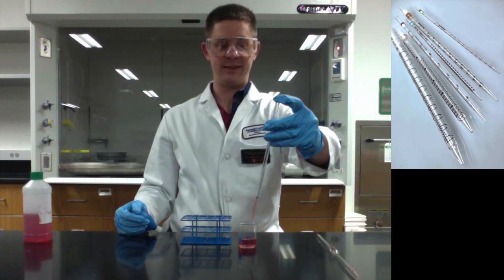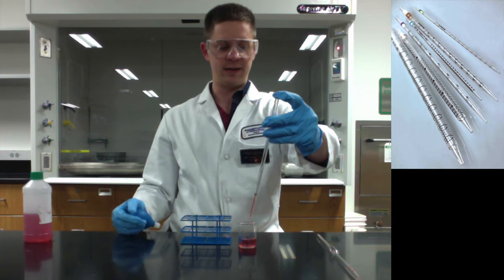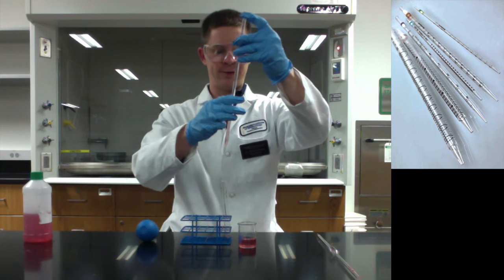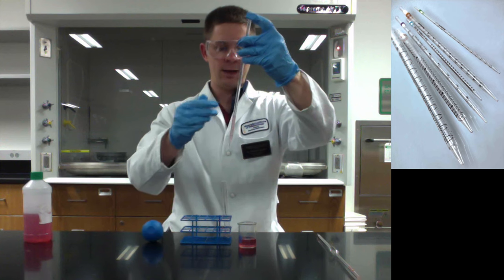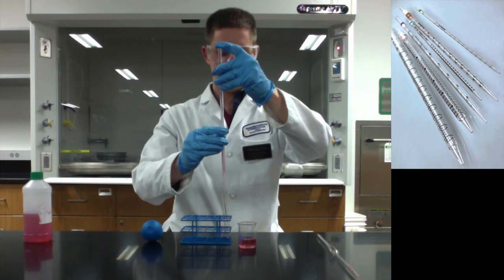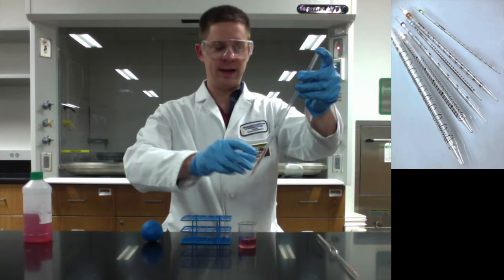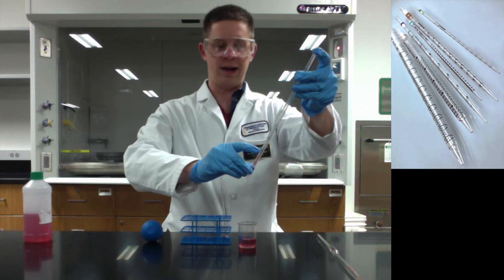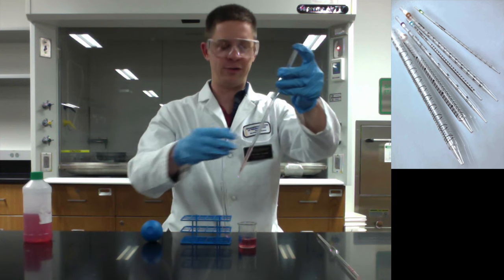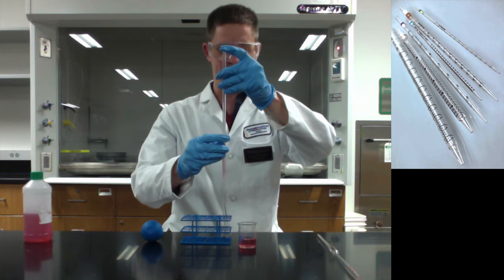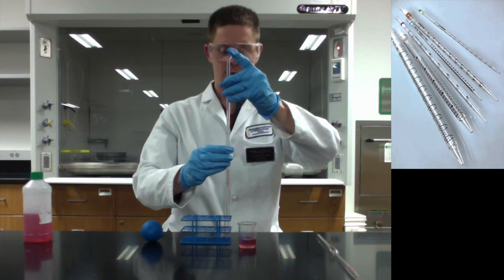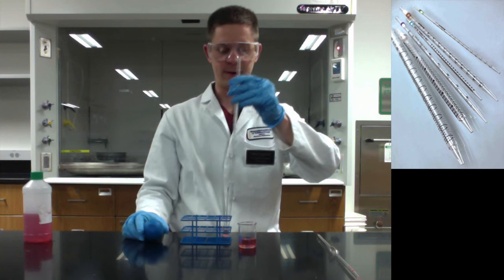I need to be really careful to hold that seal so that liquid does not escape while I'm transferring it over. Same as the volumetric pipette, really. And then, and you'll notice, by the way, if you look really carefully, that this is the 3.1 line counting down from the top. And that should make sense. The sum of the two needs to be 5. And I'll release the seal and let it rip.